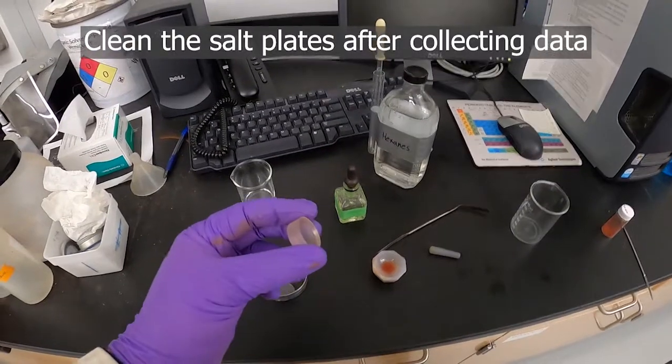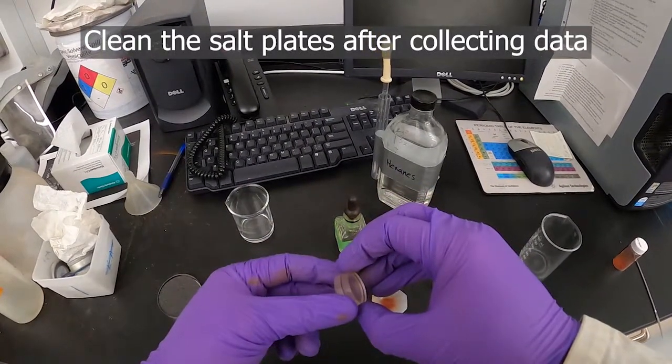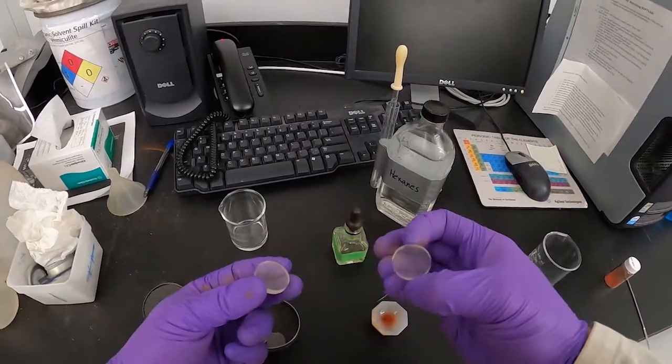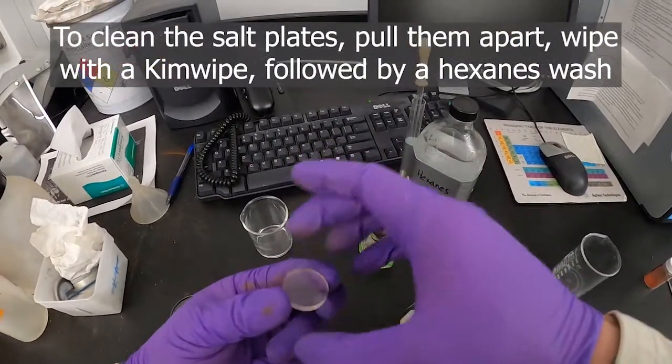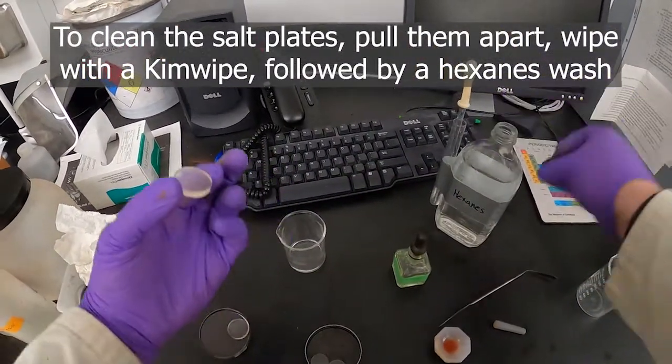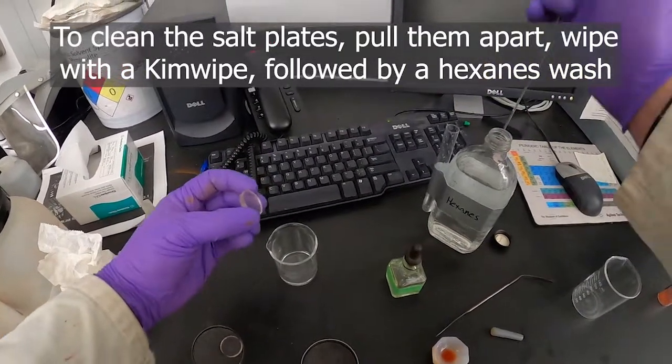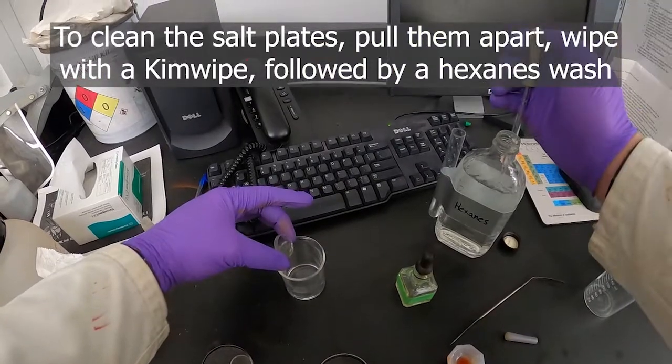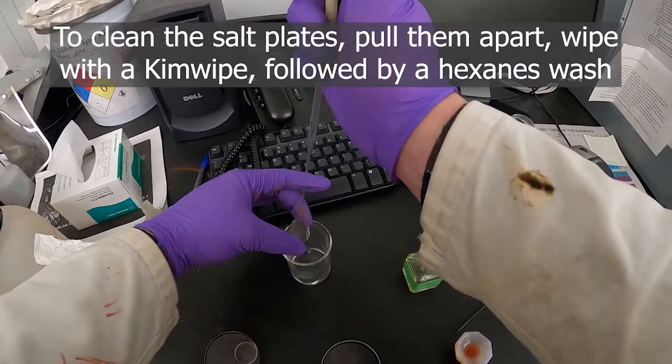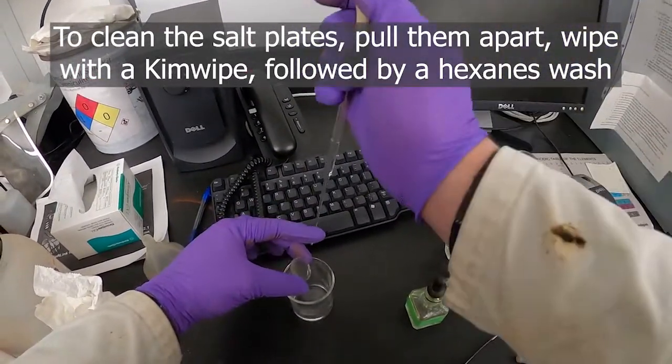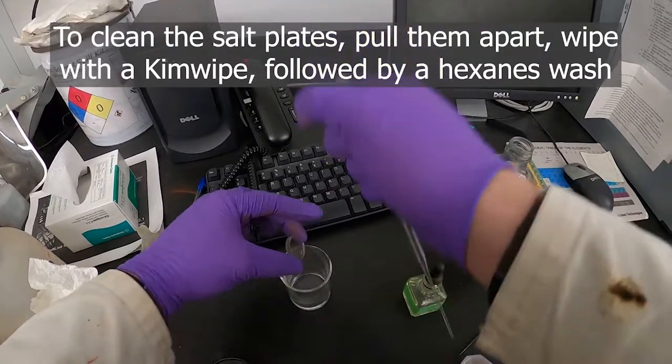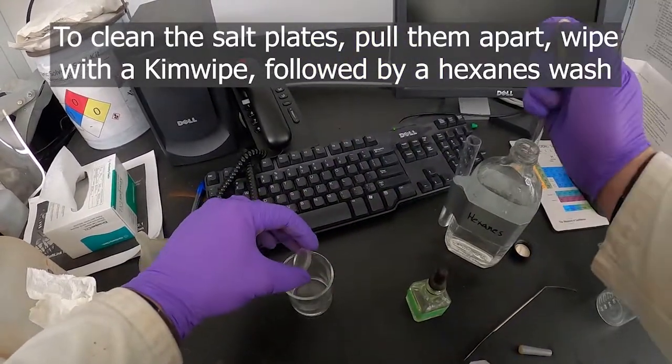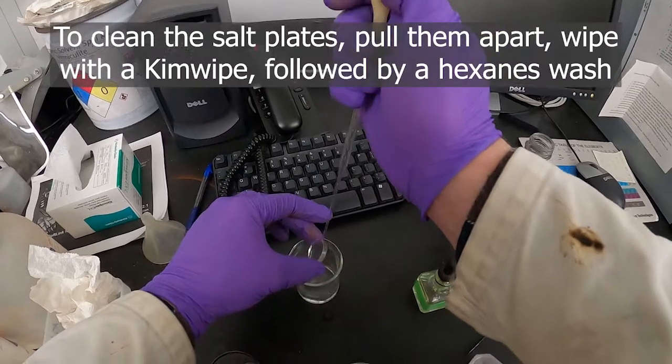Now that we're finished collecting our data, we need to clean the plates. Pull them apart here. And again, we just rinse them with hexanes. You can also rinse them with chloroform. Give them a healthy rinse here on both sides.